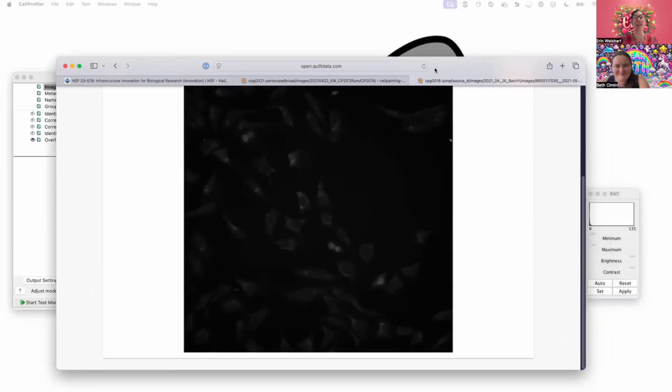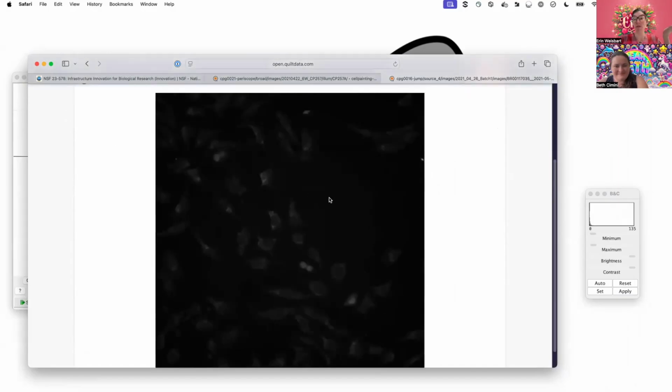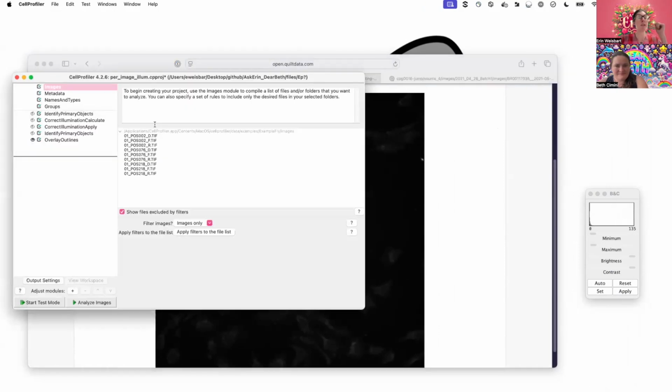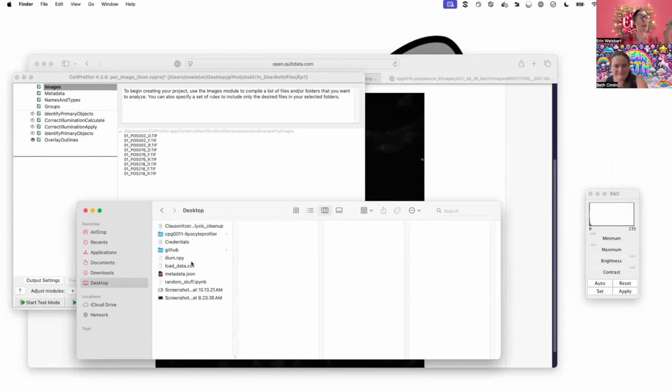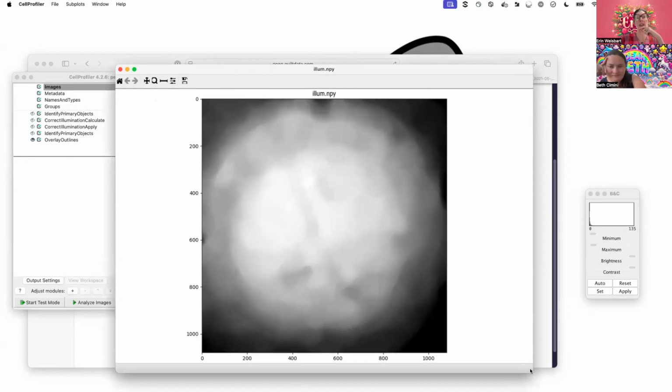I guess an interesting thing to say is, I was just browsing through the cell painting gallery, which we will talk about very soon. Depending on how you are viewing the image, you might not even be able to readily see the difference. But what this looks like once we create these illumination corrections, when we take an average of all of the images in a channel, this is actually sort of what is underlying. So it is darker in the corner, and brighter in the center.